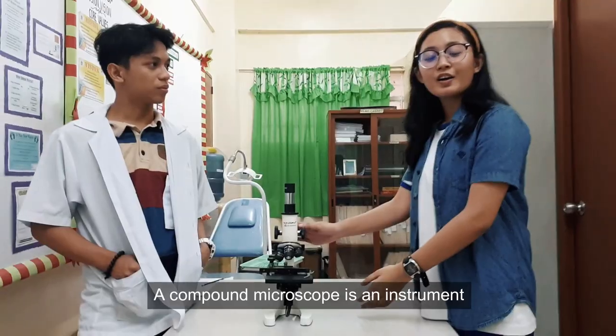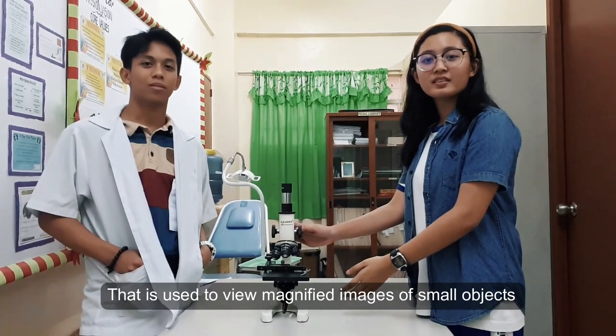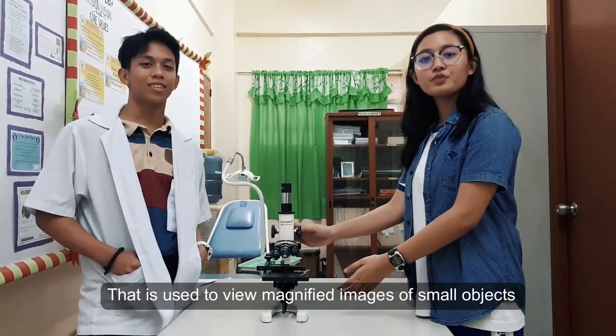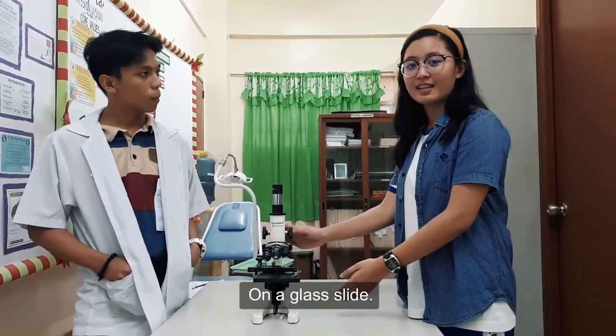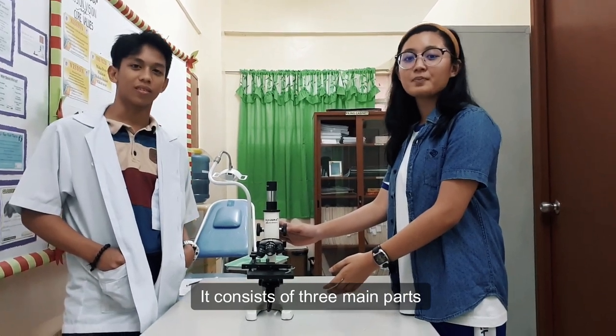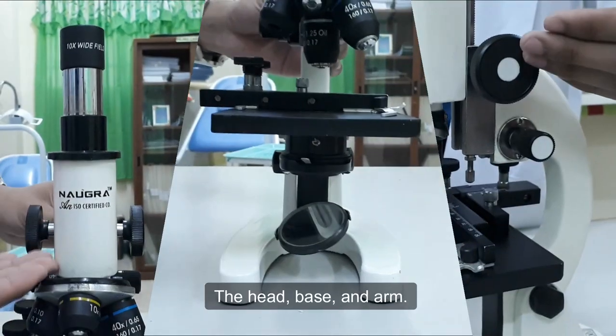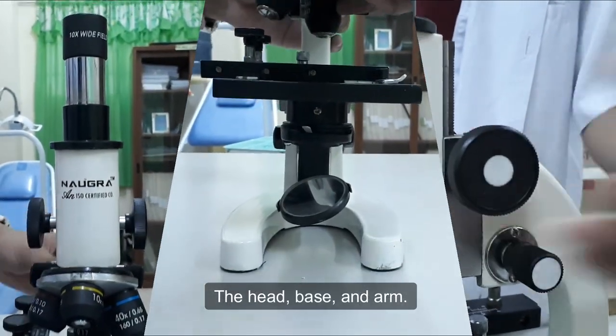The compound microscope is an instrument that is used to view magnified images of small objects. It consists of three main parts: the head, base, and the arm.